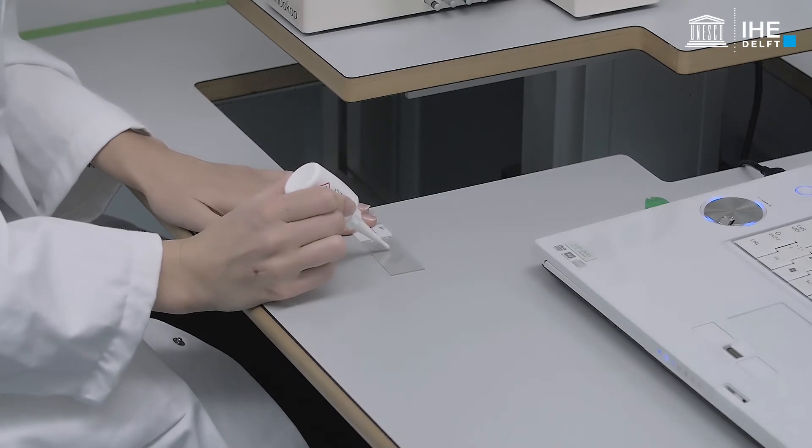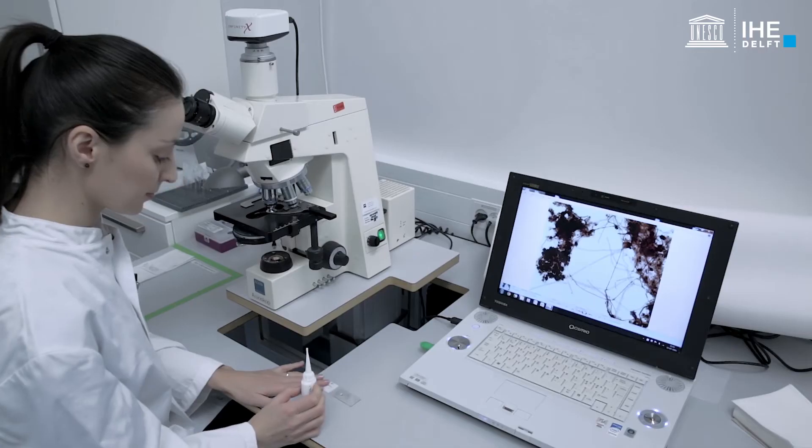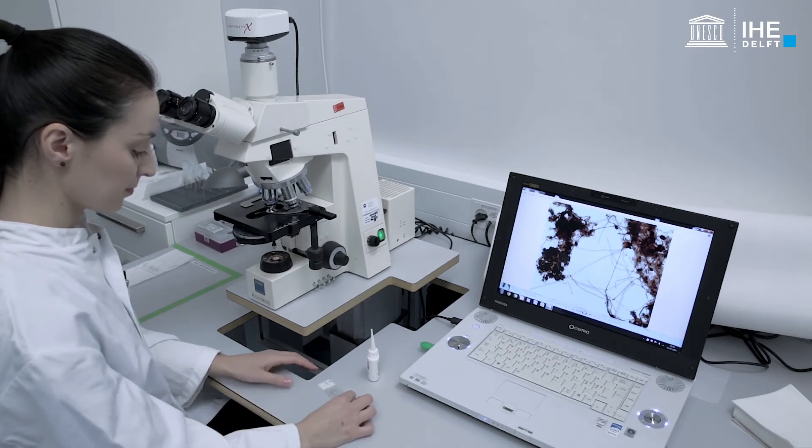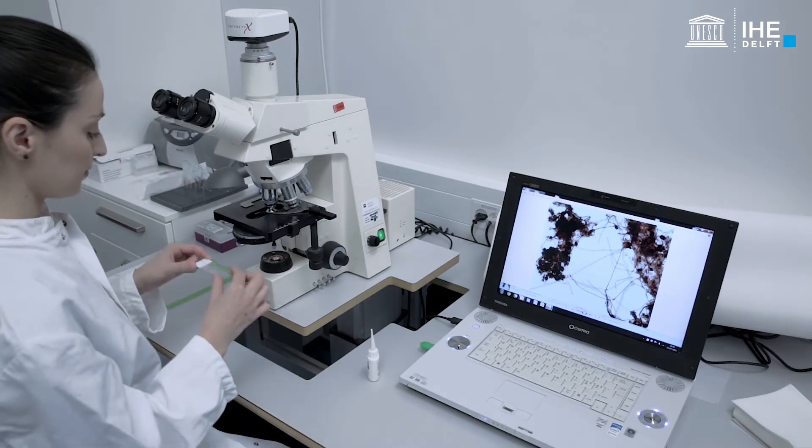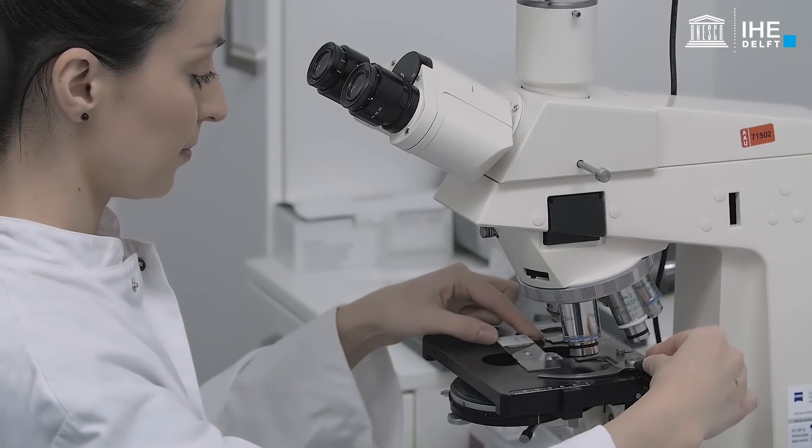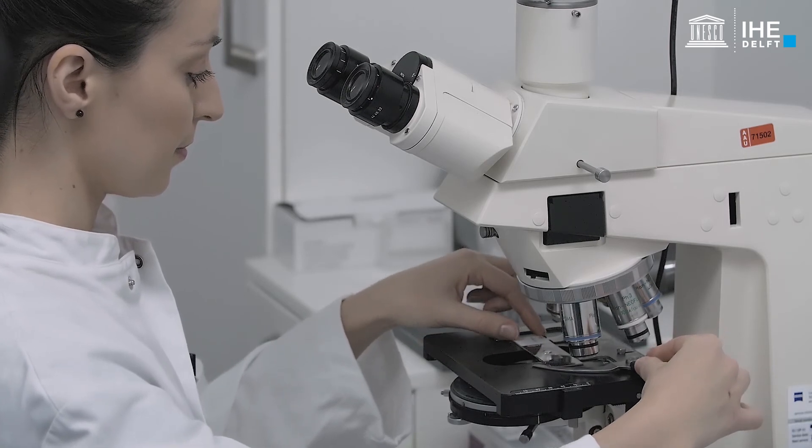Examine the slide under the light microscope with oil immersion using a high magnification bright field oil objective, direct illumination and no cover slip.